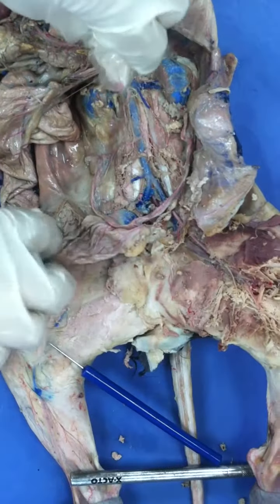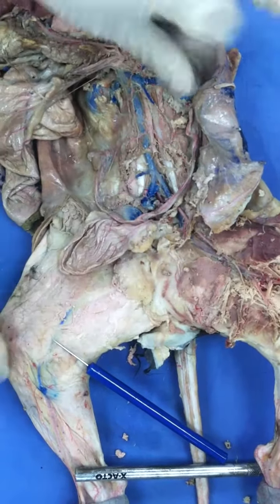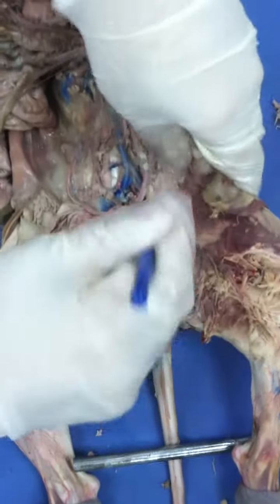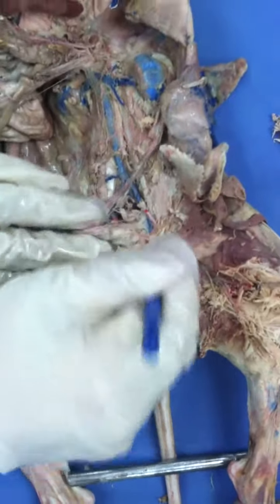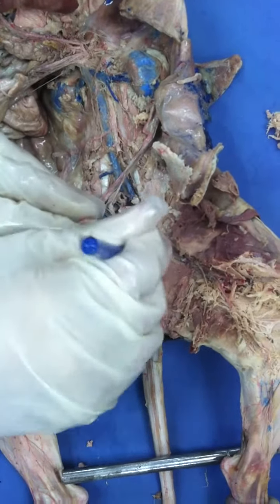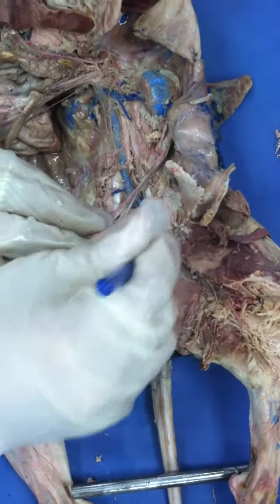And then we encounter femoral. Yeah. Popliteal, behind the knee, the saphius, and whatever it is. Saphius, I made up the name. I think it works. So here we encounter the femoral.